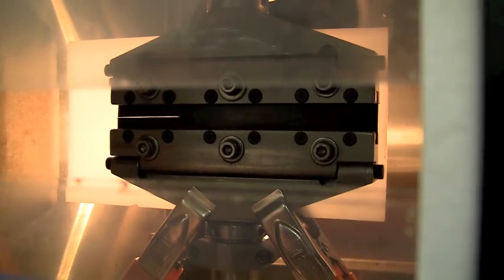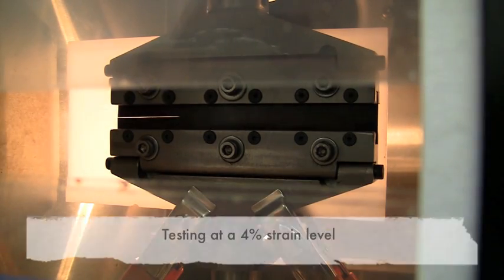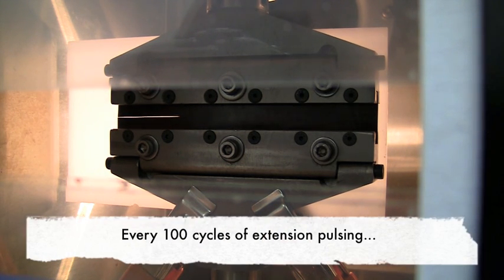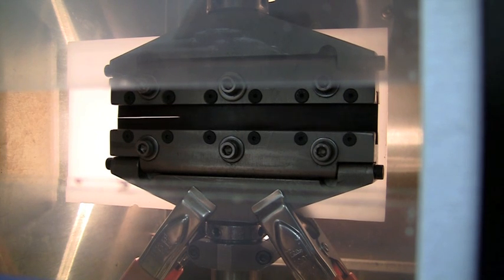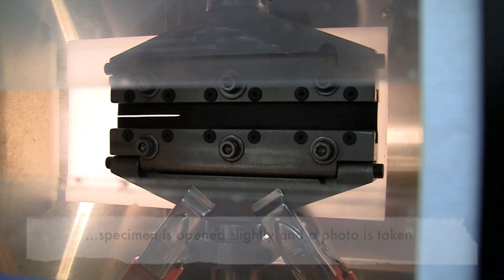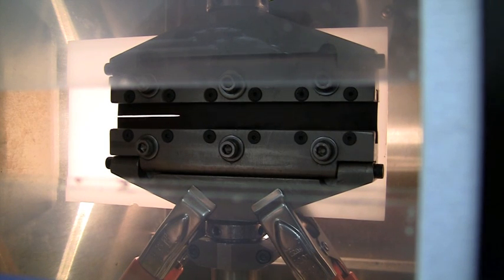The specimen's actually under test right now. This is at a 4% strain level. It's going to conduct 100 cycles of extension pulsing, and then it's going to stop. Just a few more cycles. Open up the sample slightly, and the camera takes a picture. Then once it processes the data, the test continues.